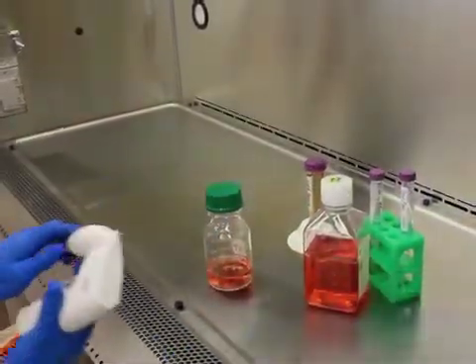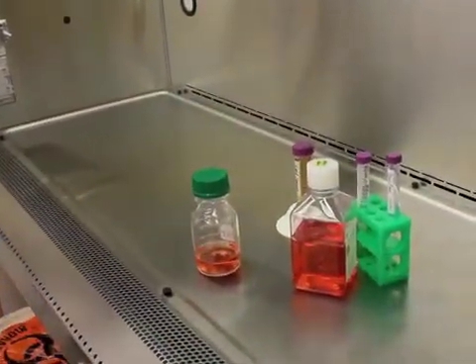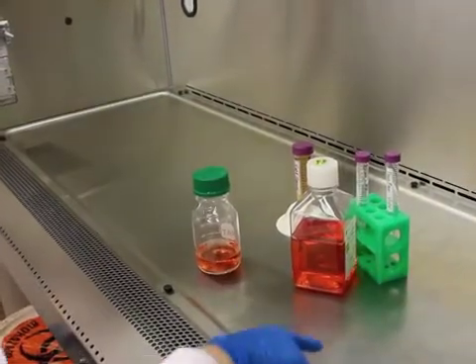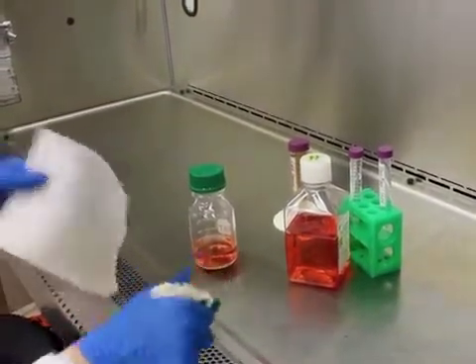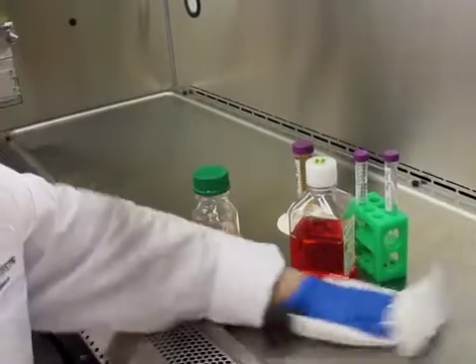I have dribbled a little medium out of the bottom of my pipette, so I am going to wipe that up immediately with 70% ethanol to prevent it from being transferred to the bottom of a culture dish or flask.